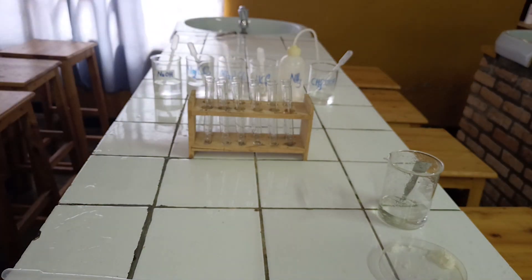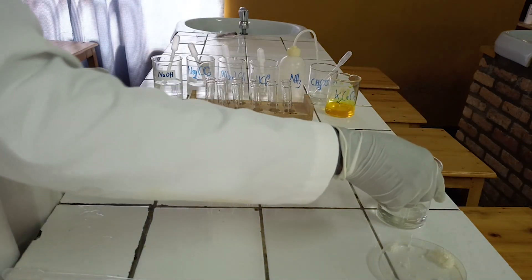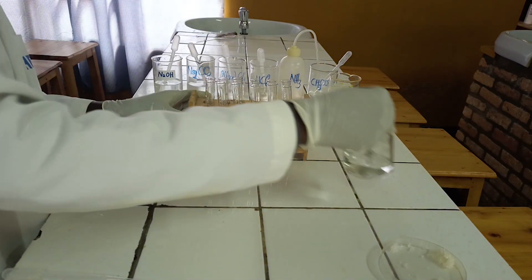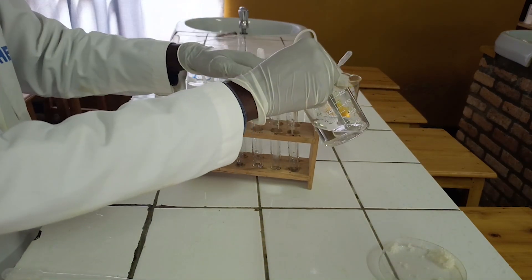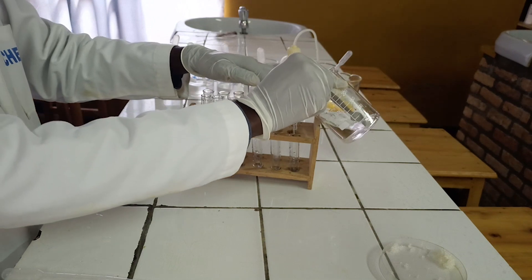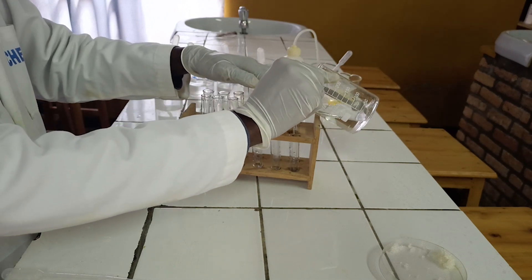Third step: divide the solution into test tubes. Put around 5 milliliters in each test tube.